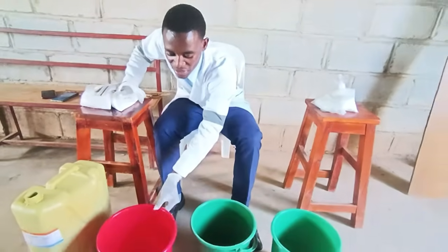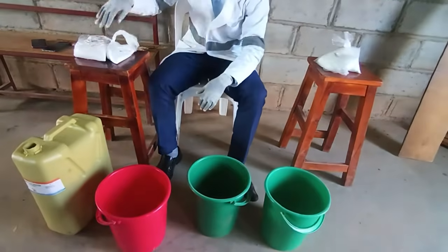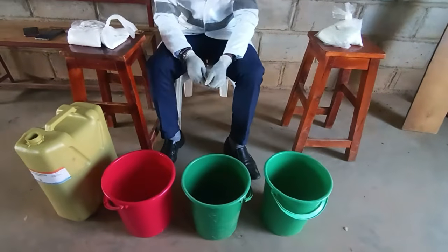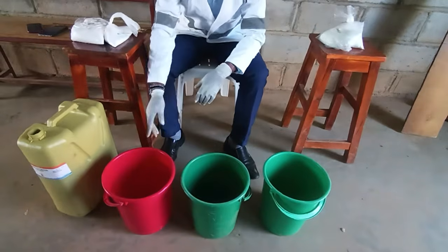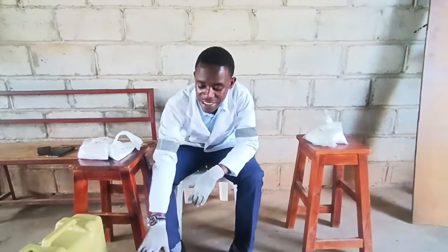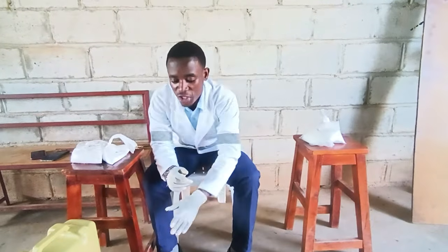Now, today we want to see how we can use all these ingredients to make our JIK. So we need 3 buckets. Right here we have the first bucket. I believe these buckets we can get them from wherever we are. If you don't have a bucket, just use any other container which can accommodate 5 liters. So these are 3 buckets. You can use basins if you're at home and you don't have such buckets. We say that 1 bucket, when we fill it with water, has how many liters? 10 liters. It has 10 liters. But we need only 5 liters in each bucket.